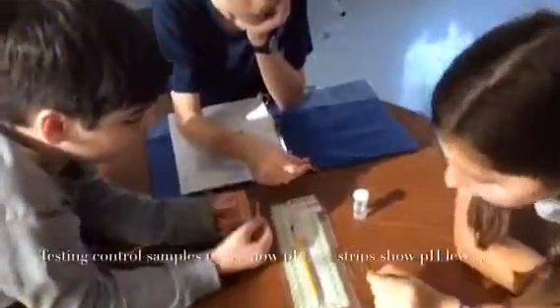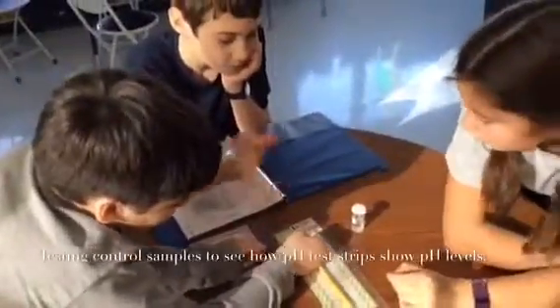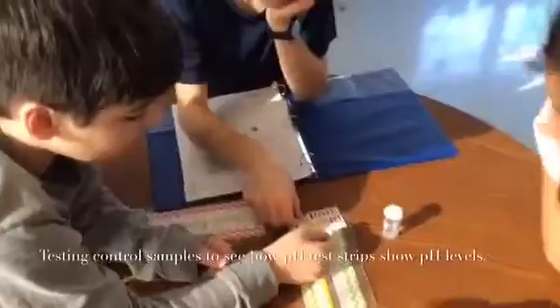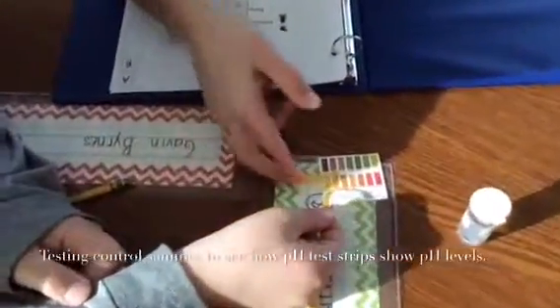Awesome. So let me ask you. What did you guys find out? It's neutral. It's about 6.5. Did it change color? Now, yeah, it got a little bit lighter.